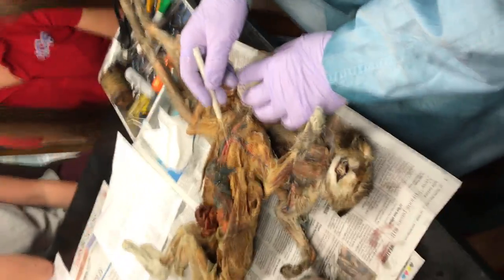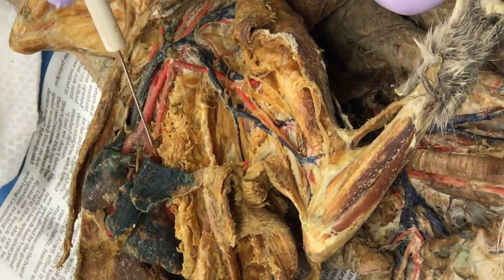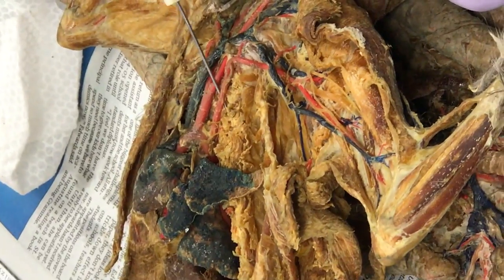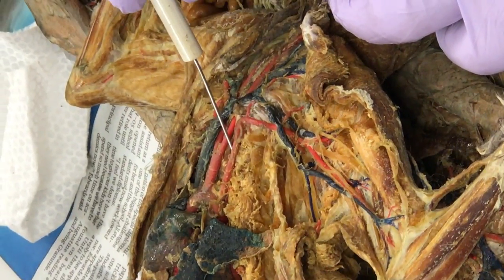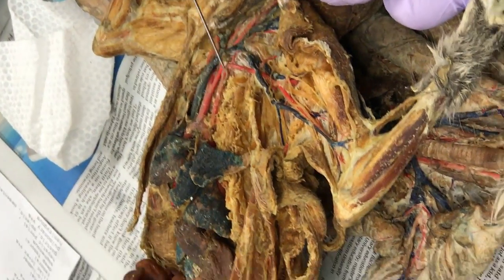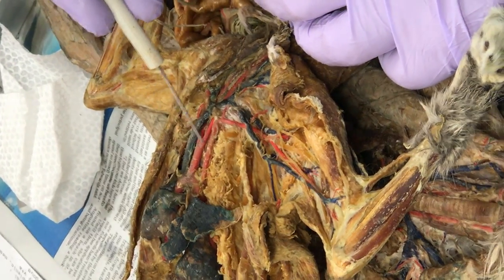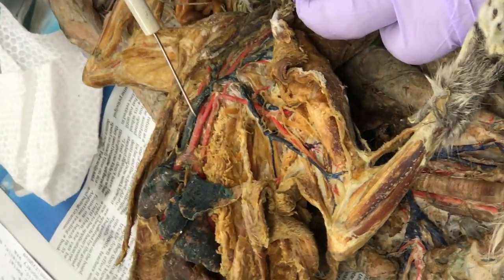Let me go over the arteries here while we're here. This is a beautiful thing. Look at the aorta — nice and round there. You've never seen a better aorta. Look at the innominate — perfect. Look at the subclavian. This is the left subclavian — it's always as it is on the animal. Left subclavian goes all the way to here — that's a big one. Now the right subclavian isn't very far, it's right there. Innominate branches into three things — carotid, carotid, subclavian.